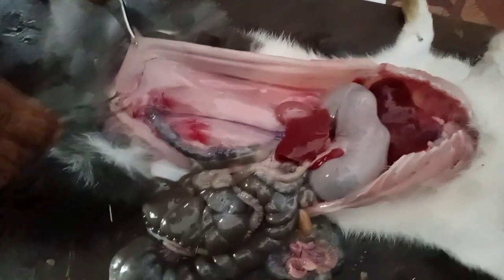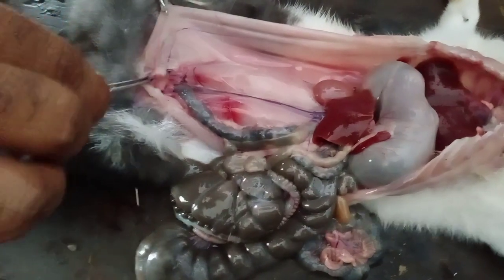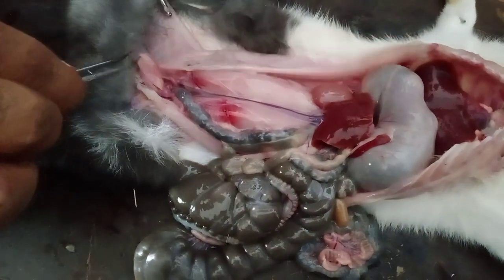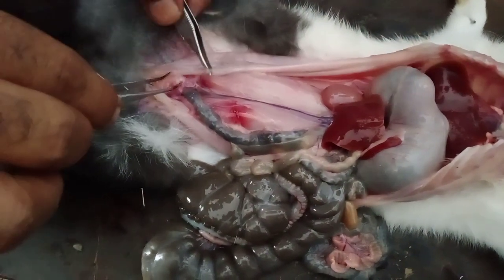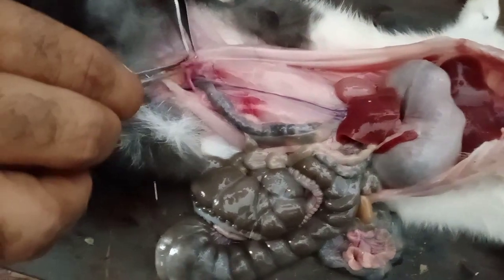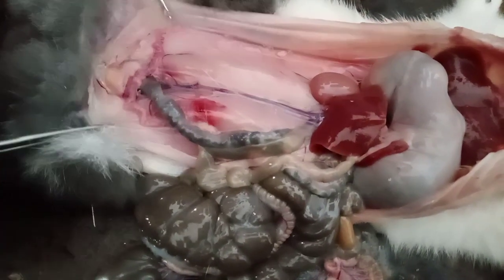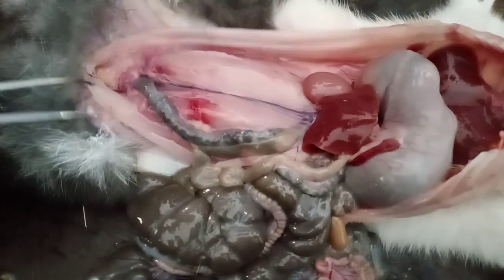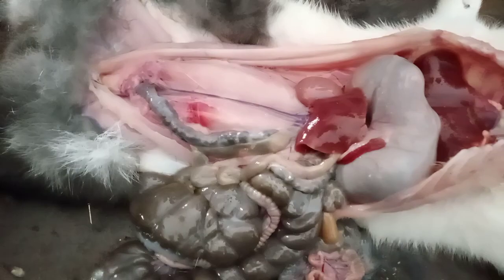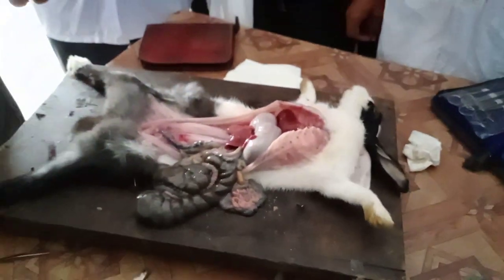And here is the urinary bladder — this is the urinary bladder. This is all about the anatomy of the specimen. Thank you very much.